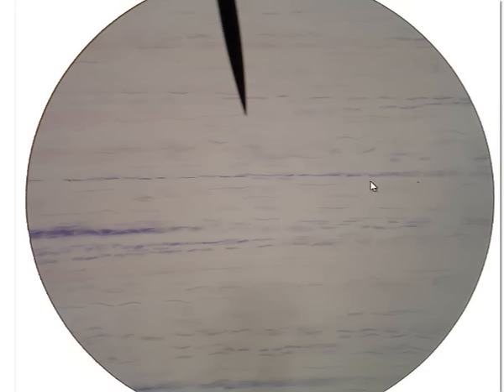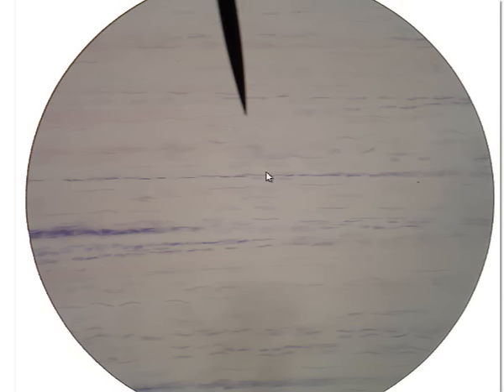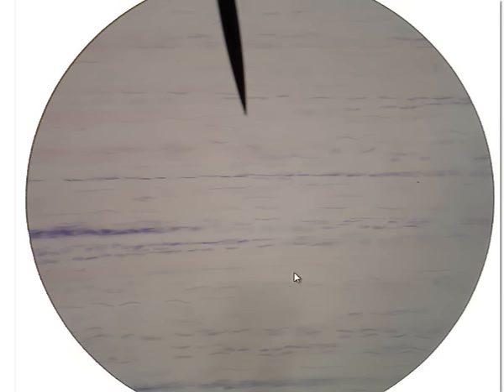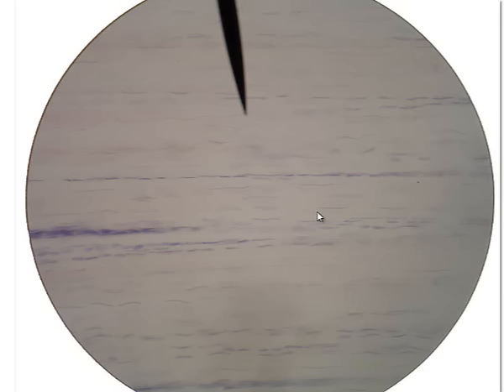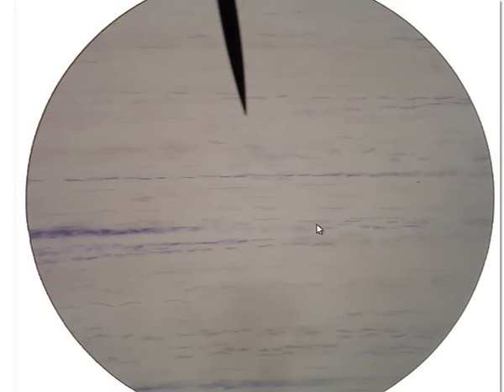This is dense regular connective tissue. The major feature I'm looking at is a kind of wood grain appearance — lines going left and right, all running in the same direction. There's lots of collagen here; those submicroscopic collagen fibers are all running in one direction, giving it that wood grain appearance. We also see nuclei of fibroblasts — the cells that live in connective tissues — and those fibroblast nuclei are flattened and running in the same direction as the collagen fibers. We would find dense regular connective tissue in tendons and ligaments.